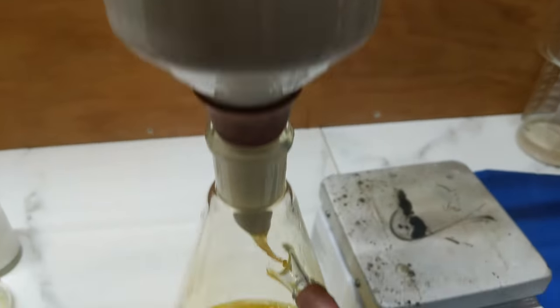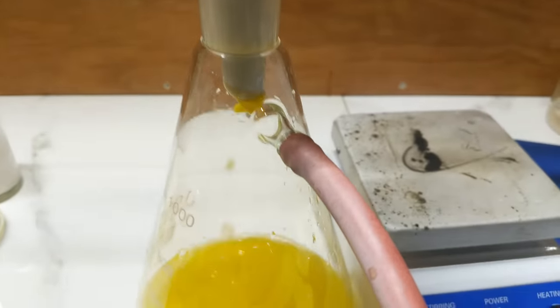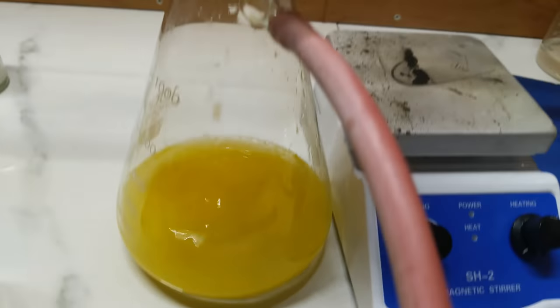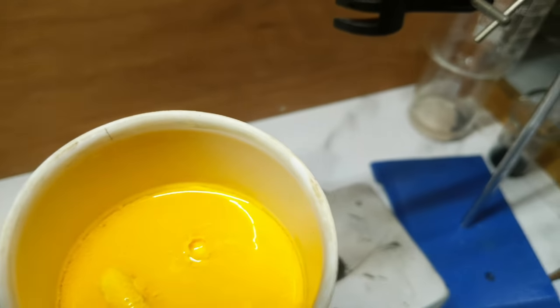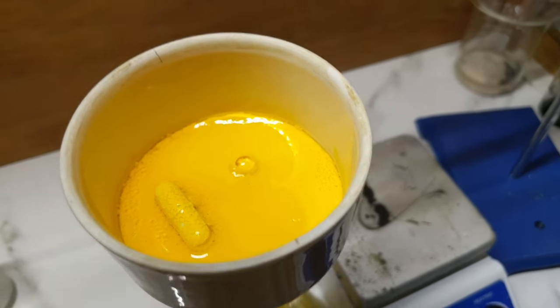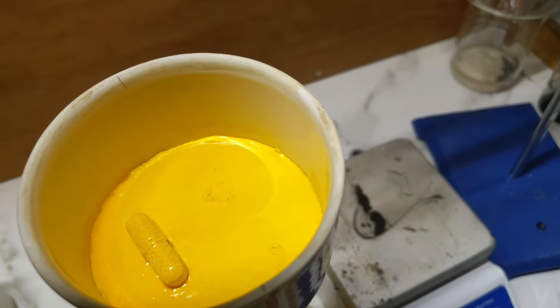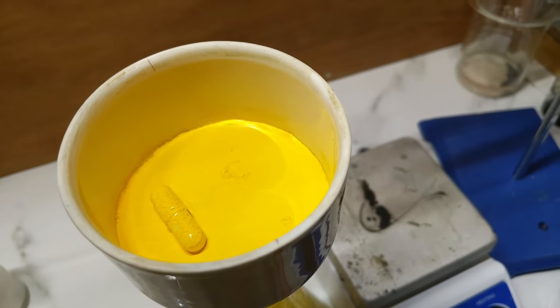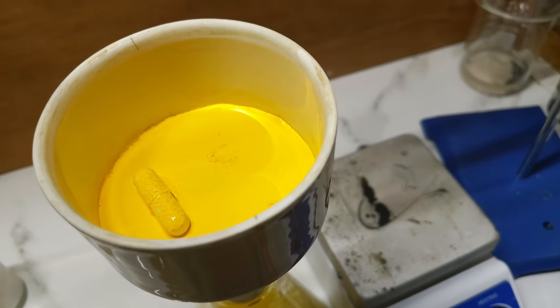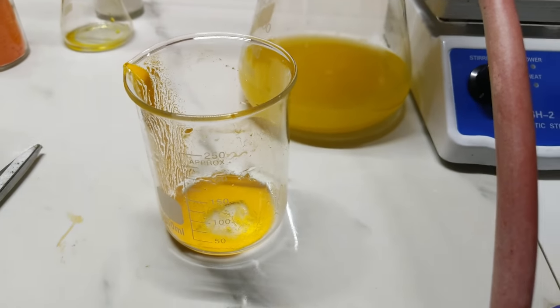It's a bit messy as the precipitate is coming through, but that's okay because most of it should get caught in the filter. As you can see there, there's a stir bar that's stuck in there as well, but it's doing a really good job of cleaning it up. I'll have to rinse this out with a bit of water and I'll keep filtering.